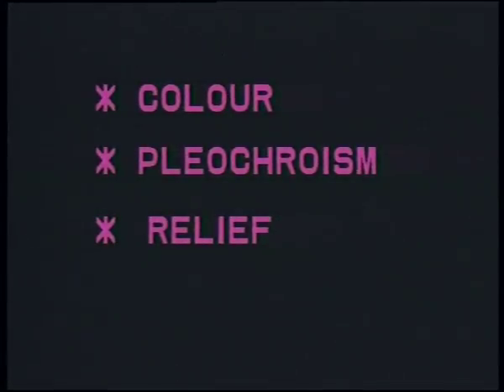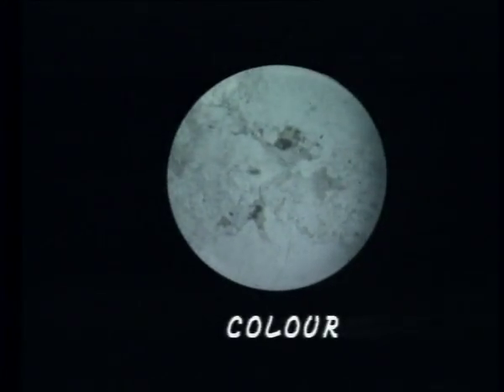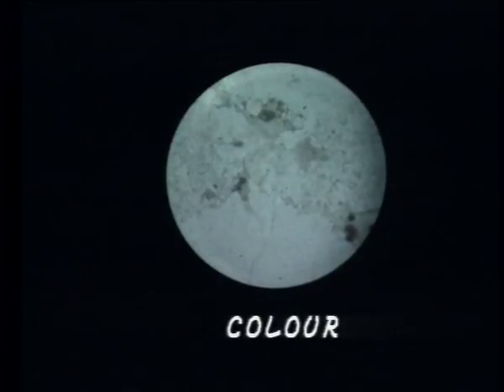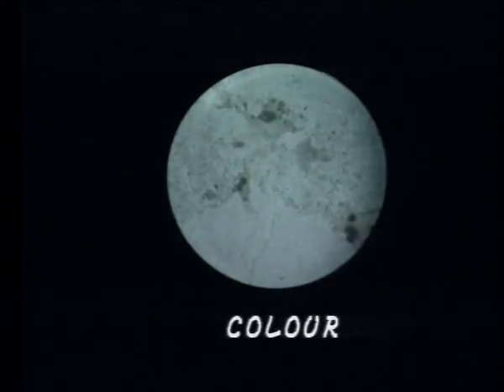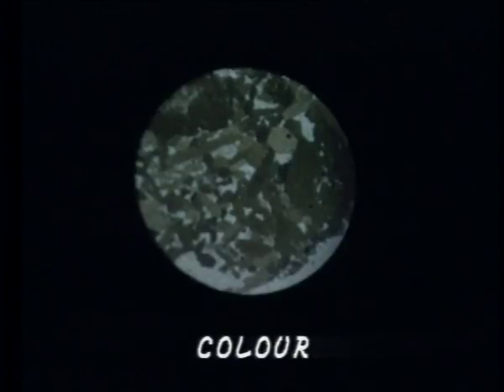The optical properties observed in plain light are color, pleochroism and relief. A large number of minerals are colorless in thin section. These include common minerals like quartz and feldspars. There are others that show distinct colors — for example, aegirine shows yellow color, hornblende shows green color and so on. Color is a diagnostic property of these minerals.